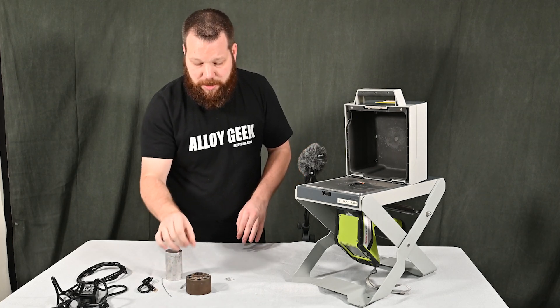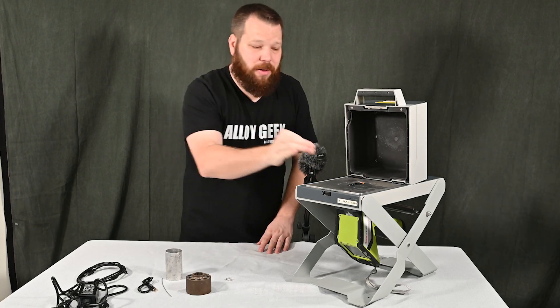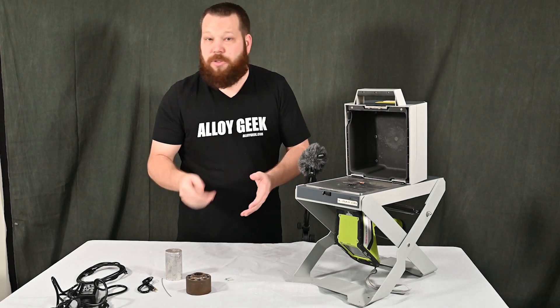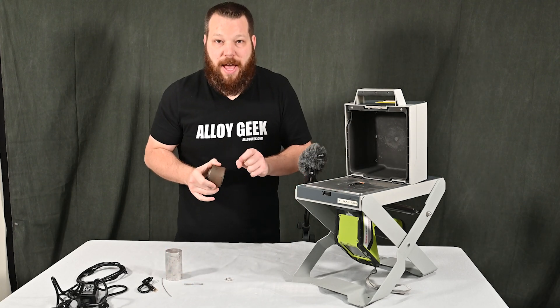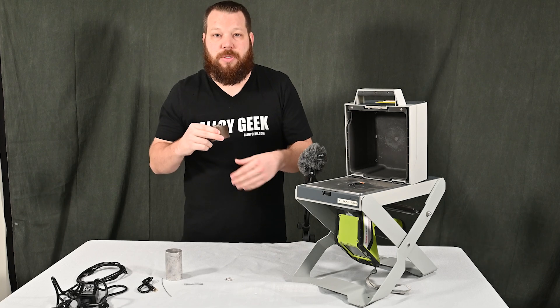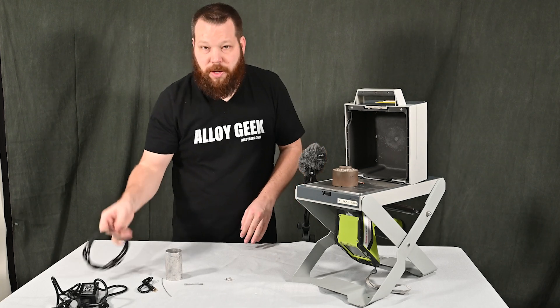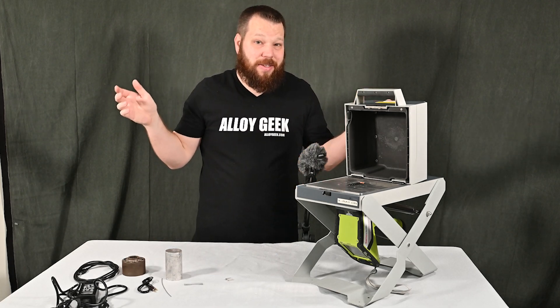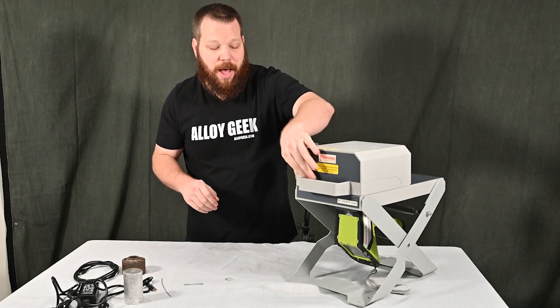The diameter of some samples is also too big for that little mobile test stand, so that's another win. For really small samples like this little piece of nitinol, there's a lot of air gap and not much metal — I can put that right over the primary x-ray beam. If your XL2, XL2 Plus, or XL3T has a camera feature, you can see exactly where you're targeting, including parts with coatings or specific regions with other metals. Connect with a simple USB cable and you're able to target exactly the location you want and run the test as long as needed.